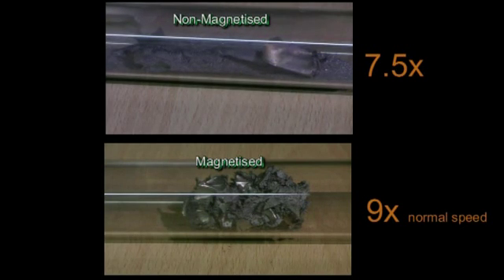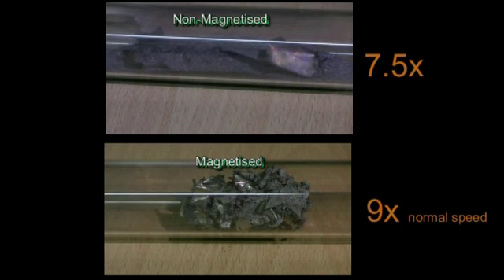However, you can see the material is still clumped together, as the unreacted material is still magnetised, and this is holding together the hydride powder within a magnetic circuit.